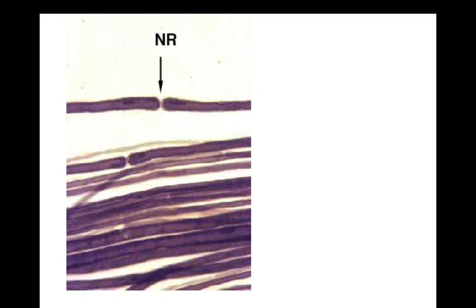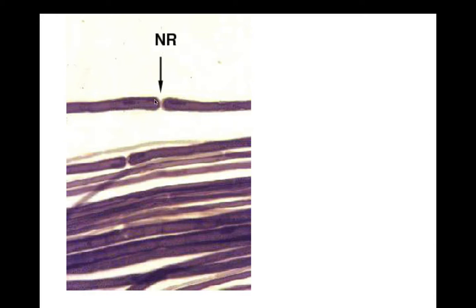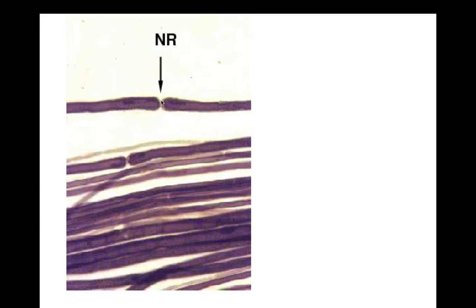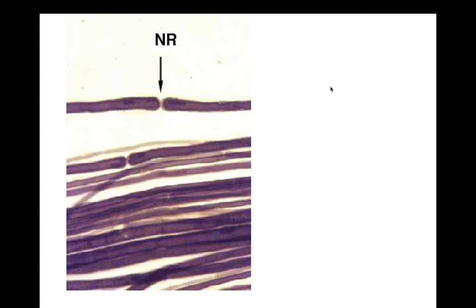By now you're saying, 'I got it, I will do fine on the lab practical.' Here is the node of Ranvier — this one's a little blurry — the myelin sheath, and the axon is in there. That is the longitudinal section of a nerve.